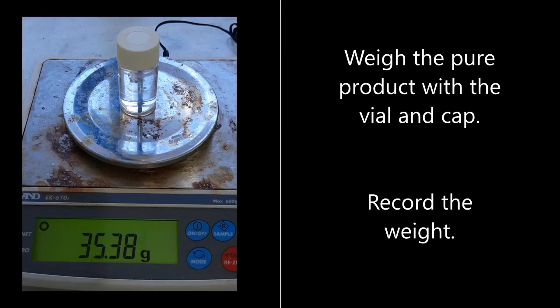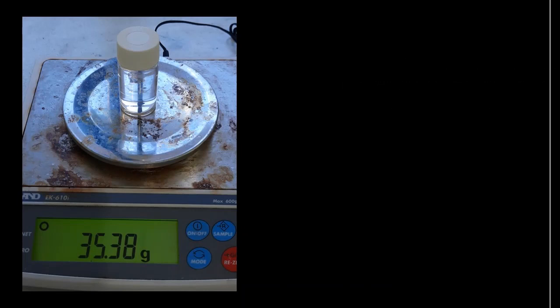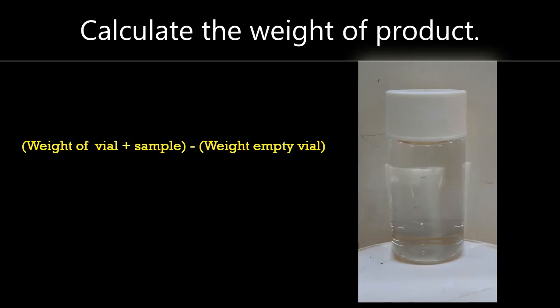Weigh the pure product with the vial cap on and record the weight. Calculate the product weight using this equation.